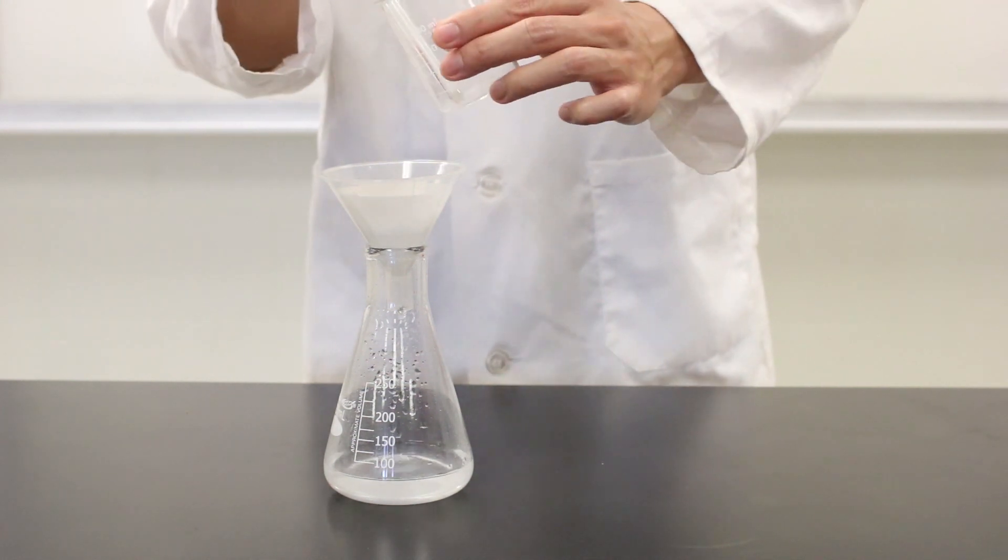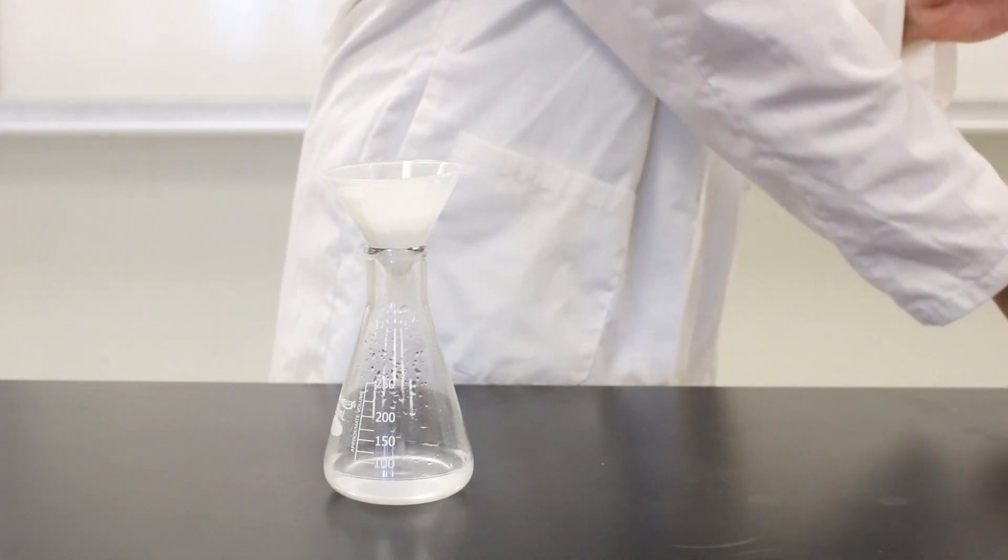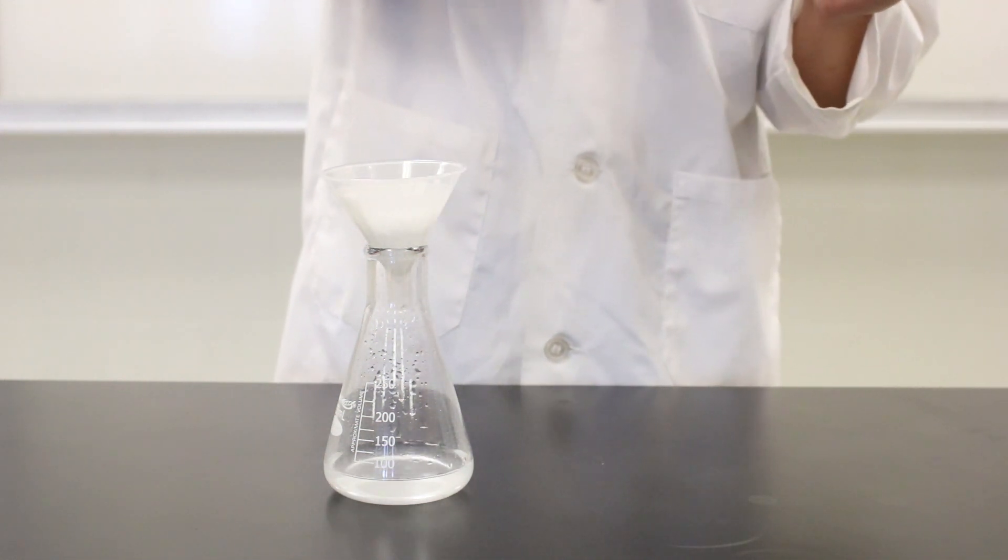And that's it for that, but I'm going to add some more water and try to get all the precipitate out. Unfortunately, it's always hard to get all of it, but we'll do our best.